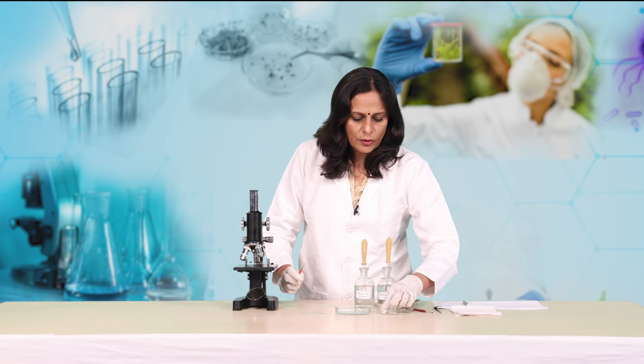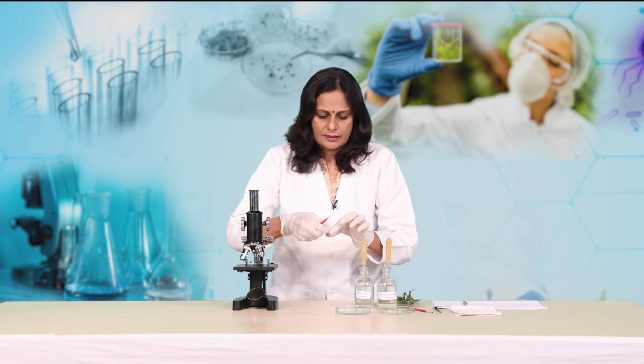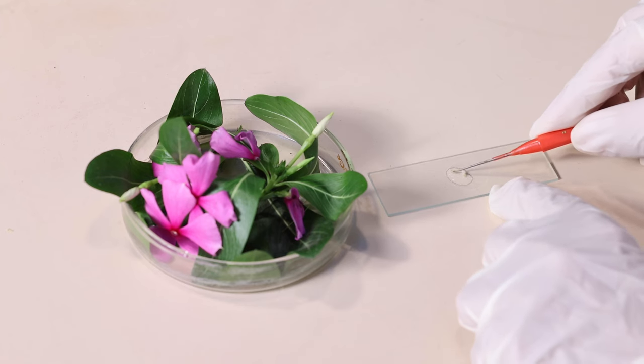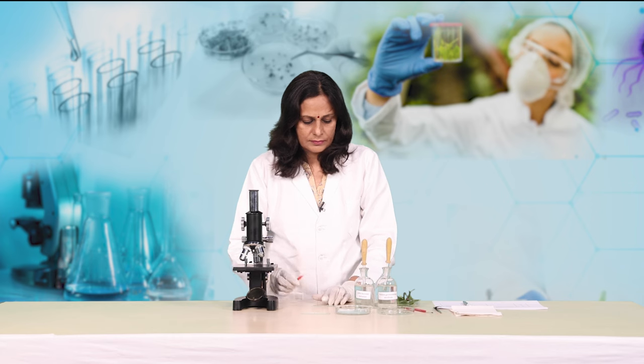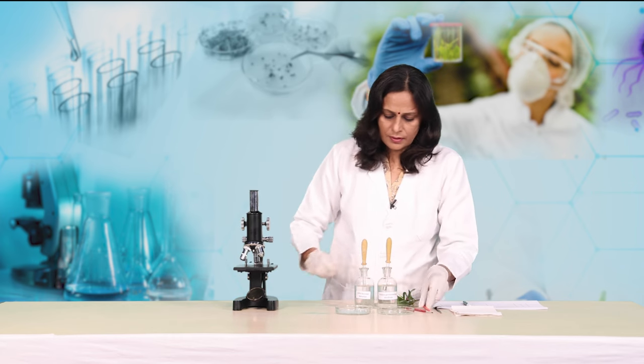Then I am going to place a cover slip onto this, lowering it down very slowly so that there is no trapping of air bubbles. Our second slide is also ready. We are going to keep this slide for 20 minutes as well, because we have to give the same time duration to both these media.